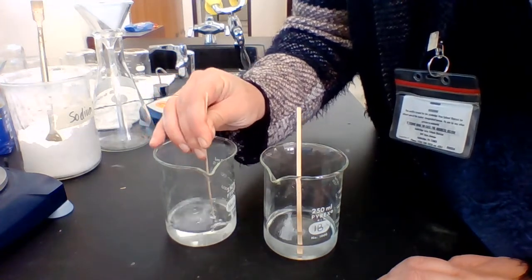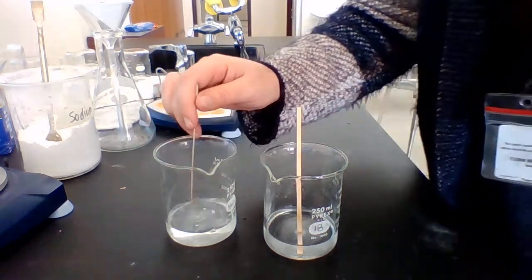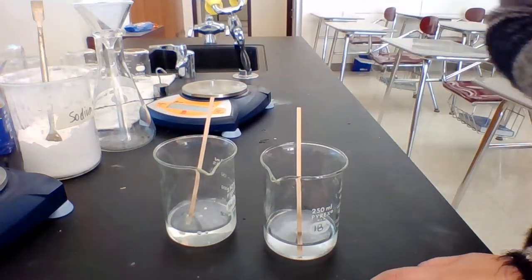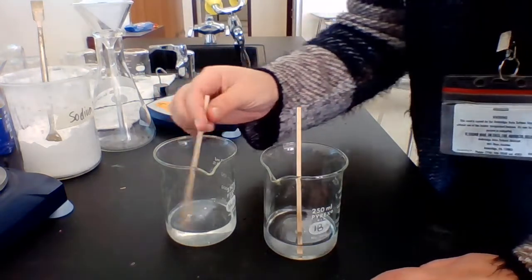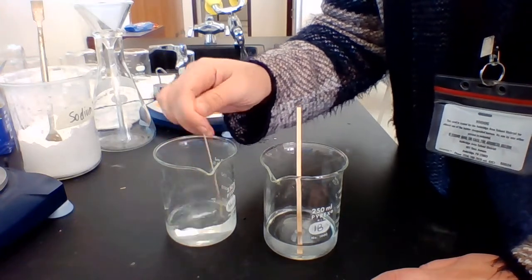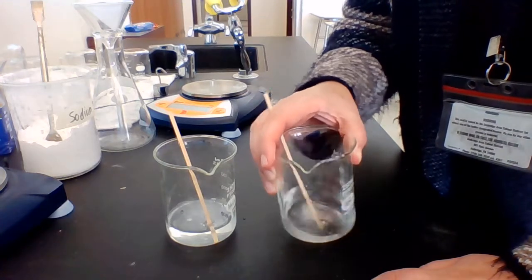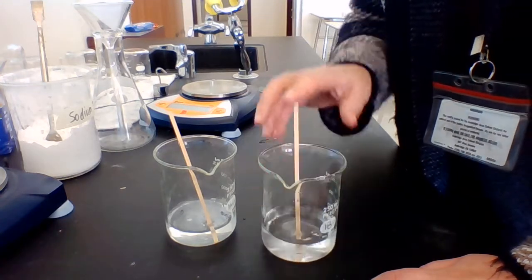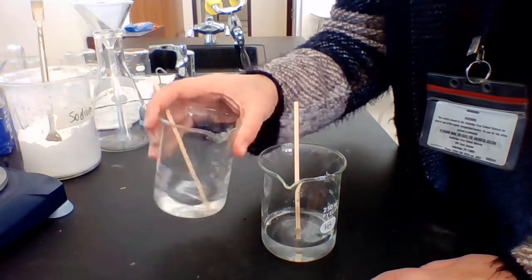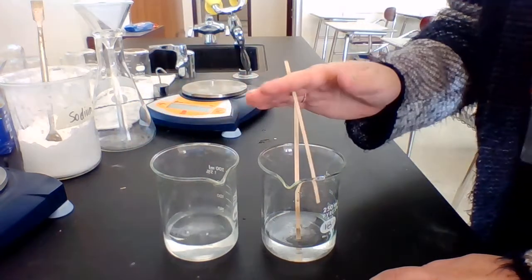Now, once we mix them, we're going to see a reaction occur. And we're looking for a precipitate. So the two substances going into the reaction dissolve completely, like salt, like sugar, whatever. And then we're going to have a substance that does not dissolve. That's what's going to be created with the reaction. That's going to be a precipitate. All right, looks like we're just about ready to go.